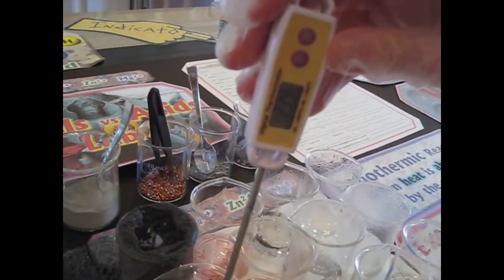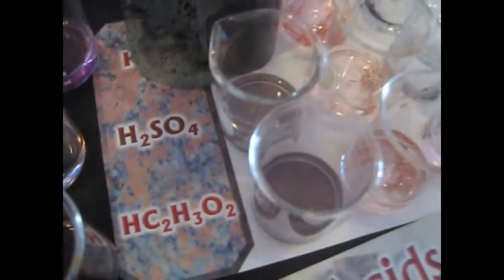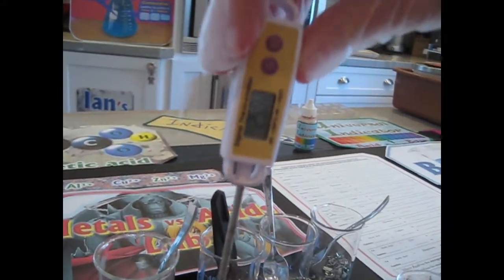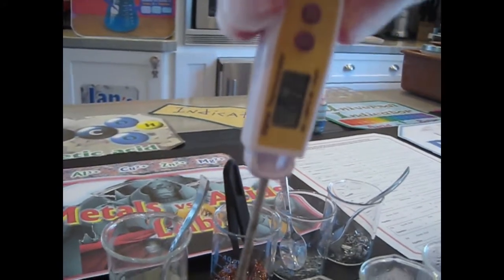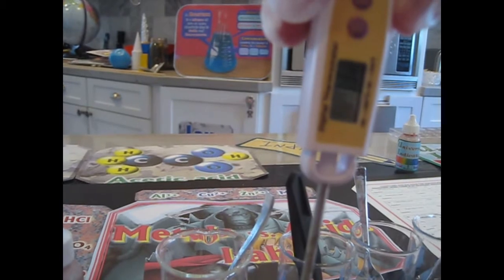What about this one? 23. Interesting. So for these two, the temperature did not seem to change. And for these two, that one changed a little. So that's evidence of a chemical reaction, a change of temperature. I'm trying to get one spot where it's not touching. Is there any liquid left in there? It's all crusted. I can feel it poking down. It may have been much warmer before, but it's definitely still going up. Yeah, 28. Okay, that's fine.